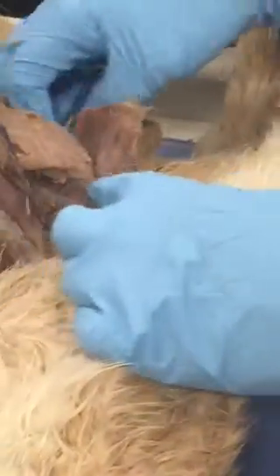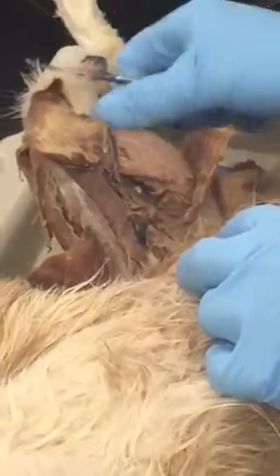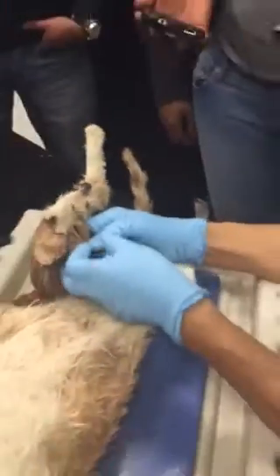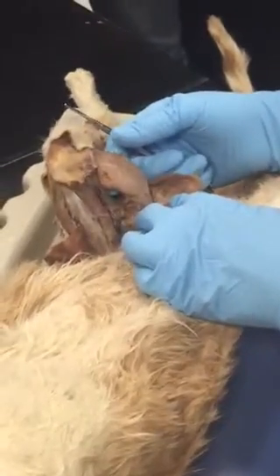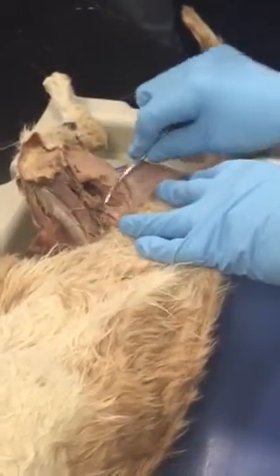Now, what is the muscle medial and deeper to semitendinosus on the human leg, which is covered? Semimembranosus. So if you go medially, really medially here, see this big chunk? Semimembranosus. So these three constitute the posterior and lateral group. These are mainly the flexor muscles, like the hamstring. This one has a function like adduction, but it's not called an adductor. So here, this group is the adductor muscles.